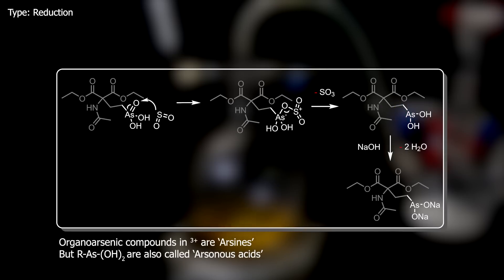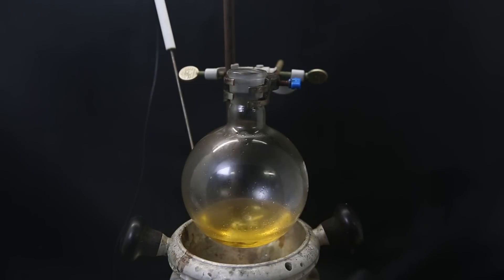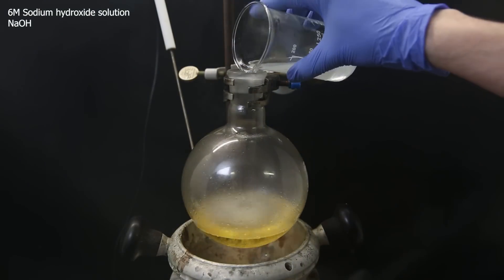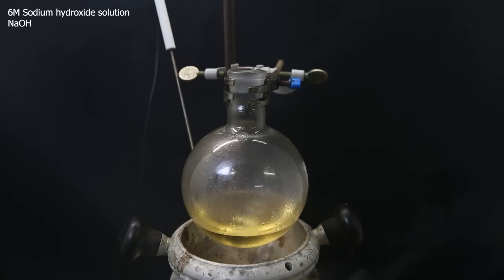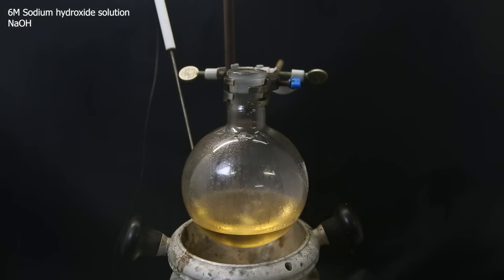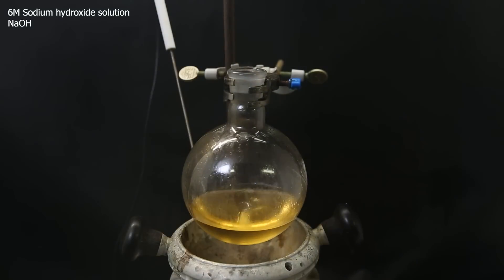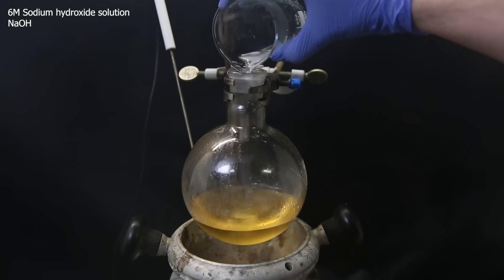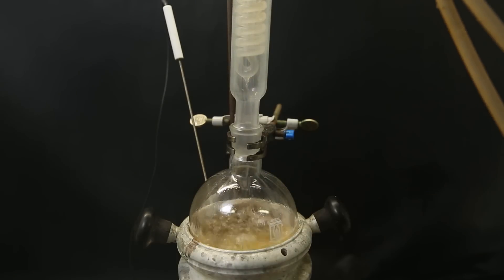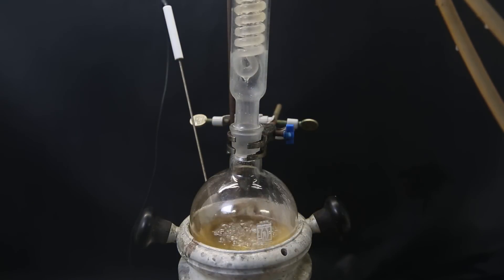After this, the mixture is basified to form the corresponding sodium salt. When I return, it looks almost the same. I neutralize all the acid and basify the solution to a pH of about 11 with a 6-molar sodium hydroxide solution. The solution can immediately be used for the next reaction. I directly add in 28 ml of methyl iodide, quickly attach a large condenser, and leave this mixture to reflux at 50°C for 4 hours.